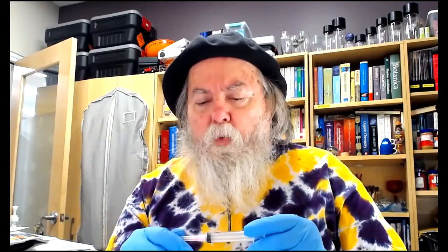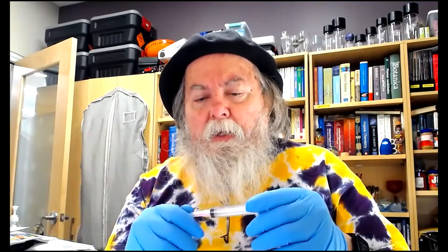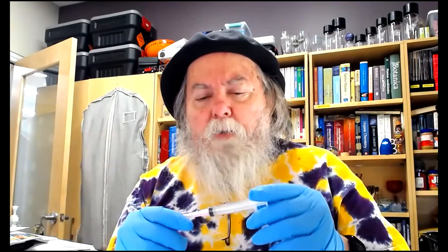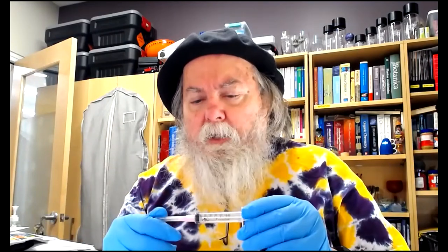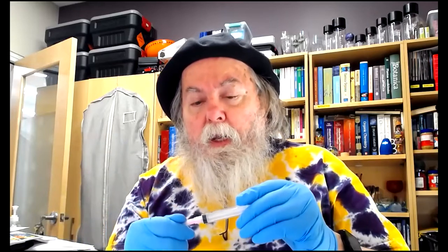You're going to walk back to the dispensing hood and put this in the container I have for used syringes. I'm actually going to wash these out and reuse these every semester. So we have to wash these carefully to neutralize the acid, then dry them, and then I'll store those in our stockroom in a separate container that'll be used just for this experiment. So after they're thoroughly dry, I'll actually put those away. But make sure these go into that container in the hood and make sure the needle's capped.